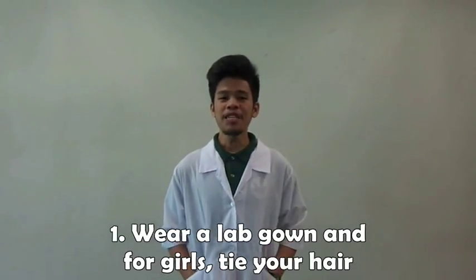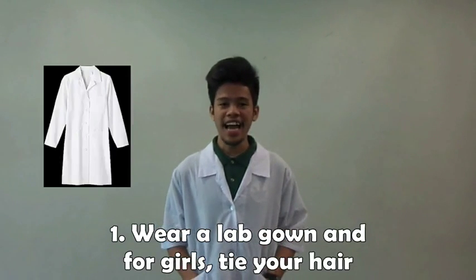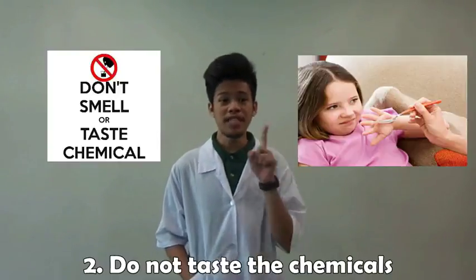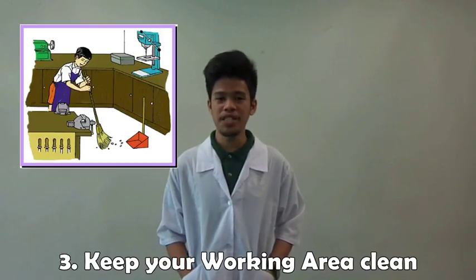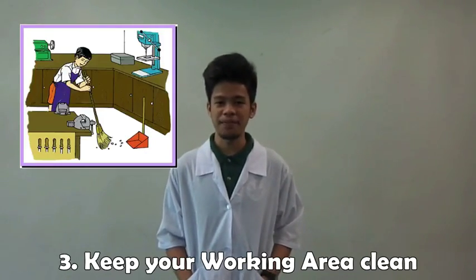First, you must wear a lab gown and tie your hair, for girls. During the experiment, you must not taste any chemicals in the laboratory. And lastly, you must clean the used apparatus and the working area.